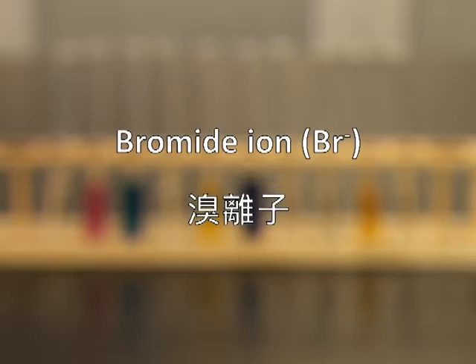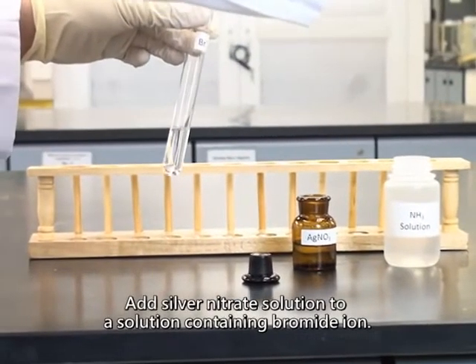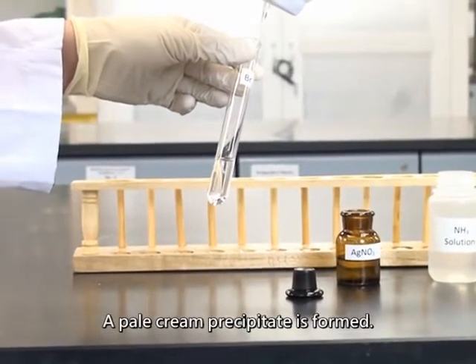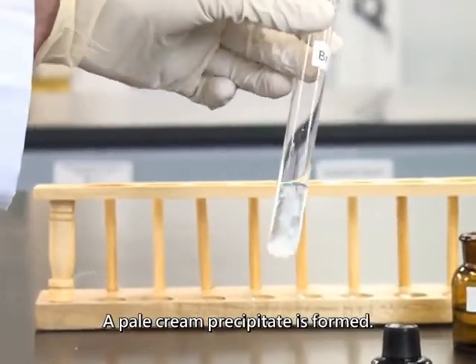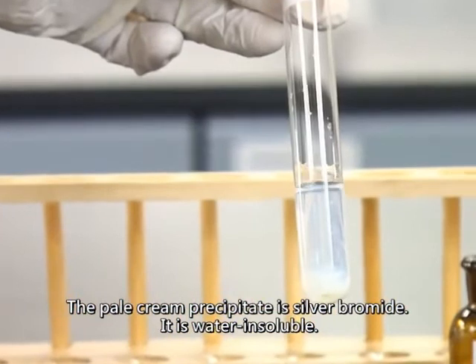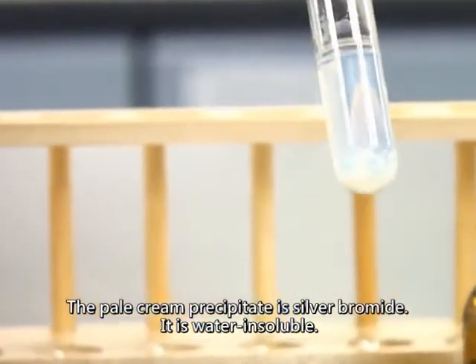Bromide ion. Add silver nitrate solution to a solution containing bromide ion. A pale cream precipitate is formed. The pale cream precipitate is silver bromide. It is water insoluble.